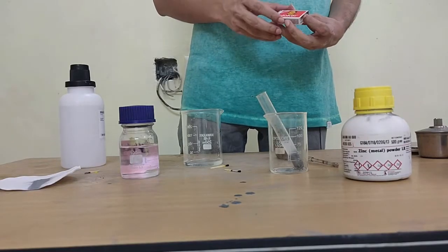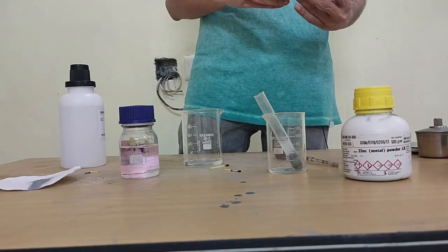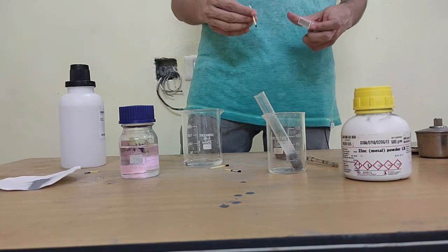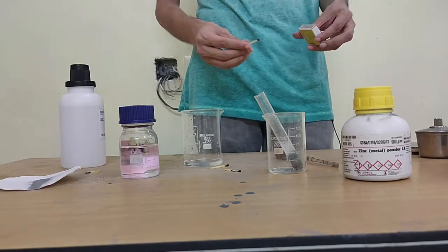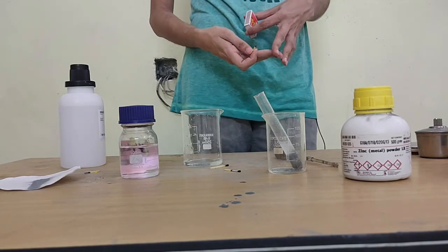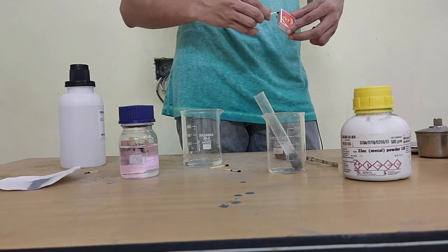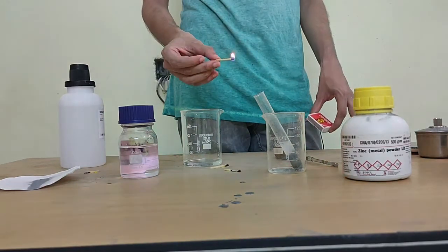And along with hydrogen gas, whatever is inside, you see, is actually a salt, okay. It's not the salt that we talk about in our daily life, not table salt, but it's salt in terms of being a product of an acid and something else. So in this case, since it's zinc and HCl, we say it's zinc chloride salt, okay. We'll put the reaction equation in the video for you to figure out. So my products for this reaction will be zinc chloride and hydrogen gas.